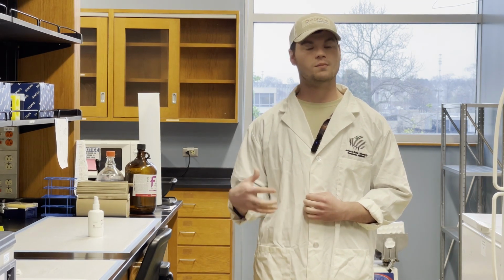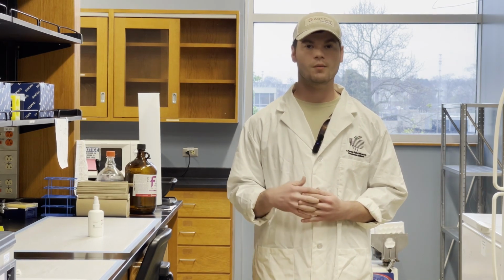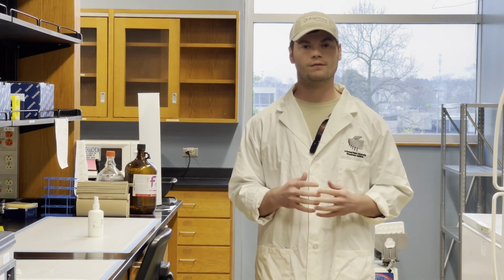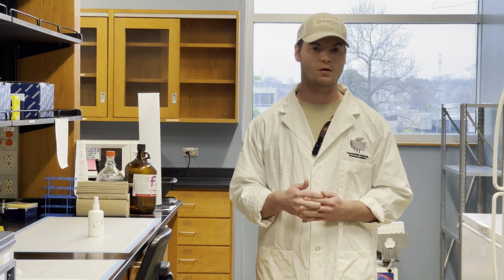Today is just going to be a walkthrough of what that looks like. Before this video, we isolated DNA from soil samples of soybean plants that had been infected with Fusarium virguliforme or treated with a sterile solution. Those came from the rhizosphere of soybean plants that are known to have genetic tolerance to the pathogen or to be susceptible. We isolated the DNA, and it had been quantified and purity checked by our lab.